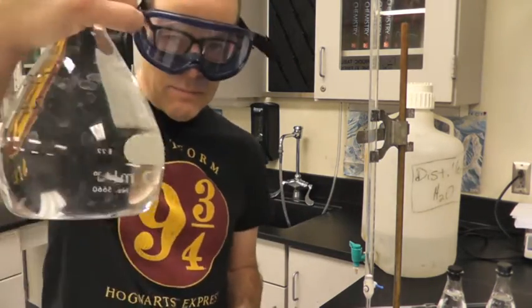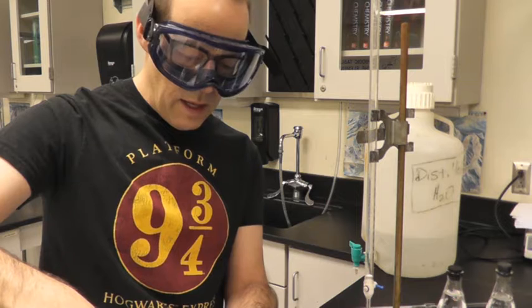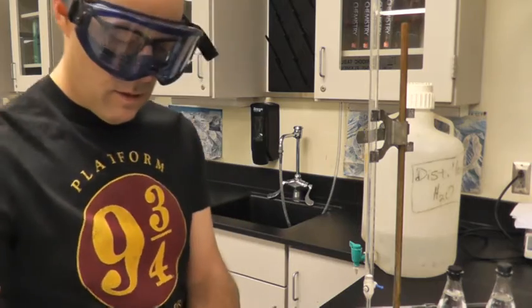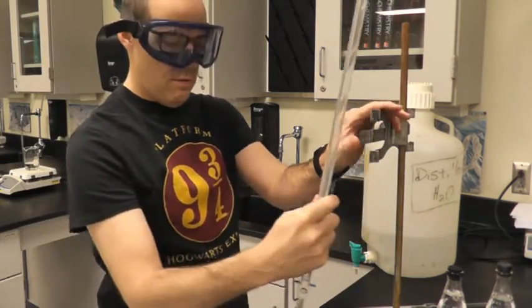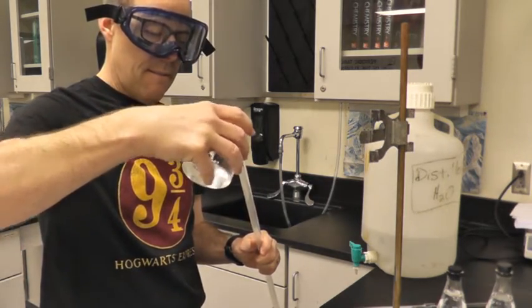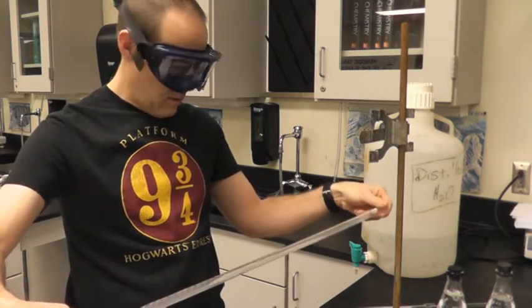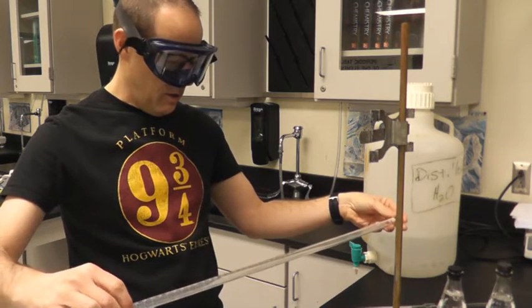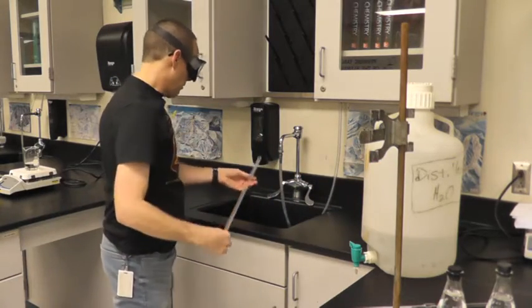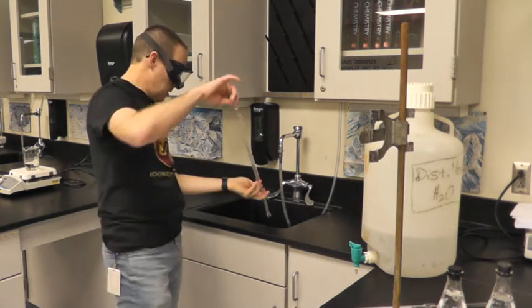So I've got a big volumetric flask of sodium thiosulfate. And like we typically do when we titrate, I am going to first rinse my burette out. So I'm just going to put some of this in. And we typically don't titrate with this. Instead of an acid-base titration, we're basically doing a redox titration. So dump that out, empty my tip with the sodium thiosulfate, dump the rest out.